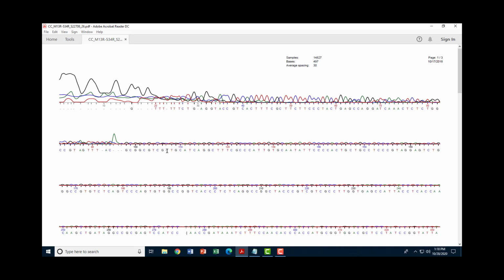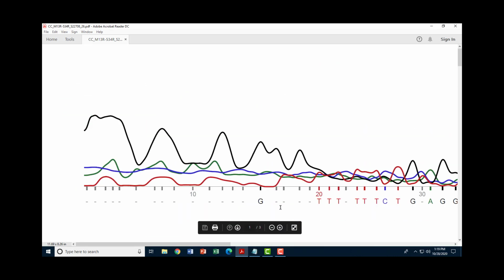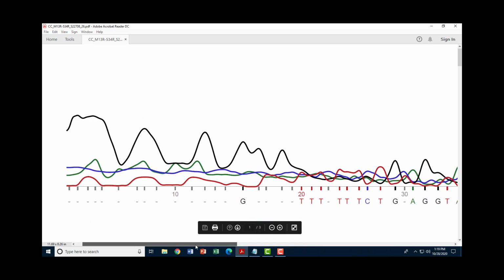Another thing you can try to do, if possible, is to work with this first sequence right here, because we have a lot of null nucleotides here at the beginning. We have signals, but we don't really know what to make of those signals. So if we zoom in a little bit on that, maybe we can kind of tease some things out. Like for example right here, position 30. I'll move that to the middle.